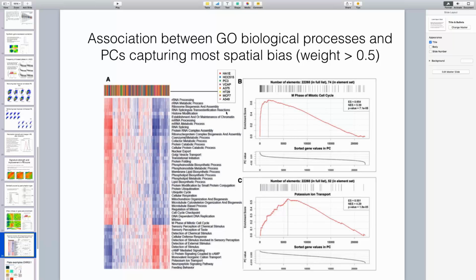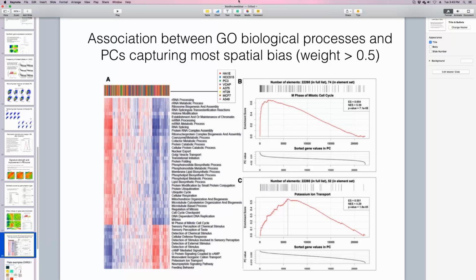In this plot, what we did is we extracted from the 1,890 plates all the principal components that we would remove by at least 50%. So they would have to have some significant bias in them. We ended up with about 2,500 principal components that showed significant bias, and they came from all 8 different cell lines. So this matrix that you see has 2,500 columns, and we just plot highly biased or highly associated enriched biological processes to them.